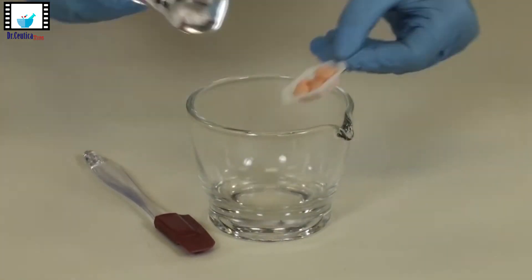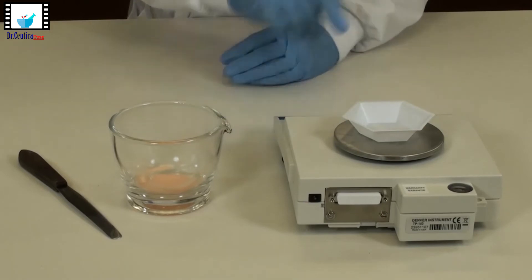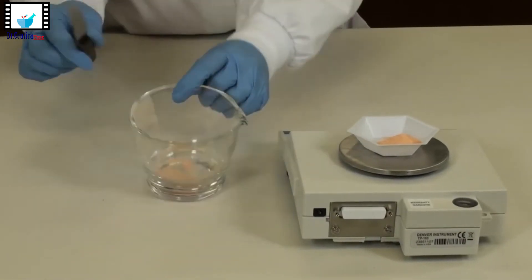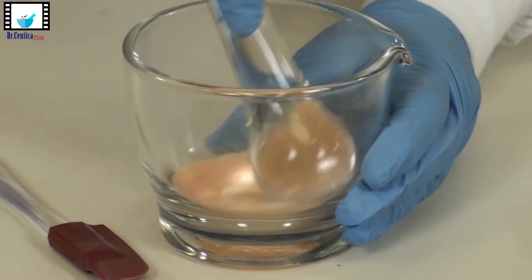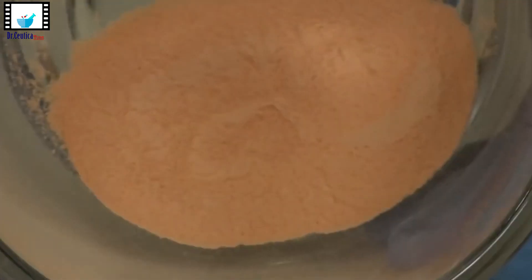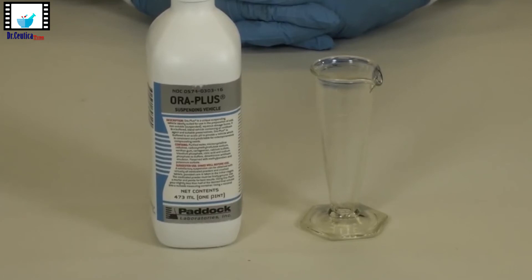The following procedure is to prepare an allopurinol-hydrochlorothiazide suspension. As we said, we start by weighing the solid ingredients first. The allopurinol is weighed from crushed tablet powder, then the required number of hydrochlorothiazide capsules are emptied. Both powders are mixed geometrically until a uniformly mixed powder is obtained.